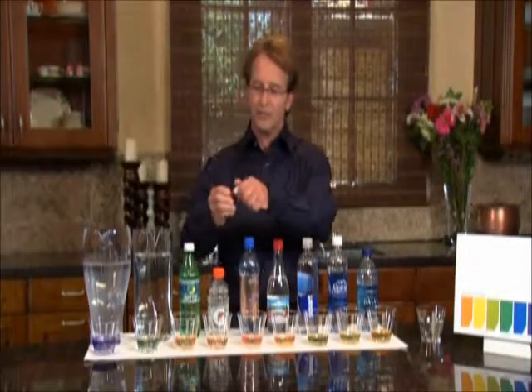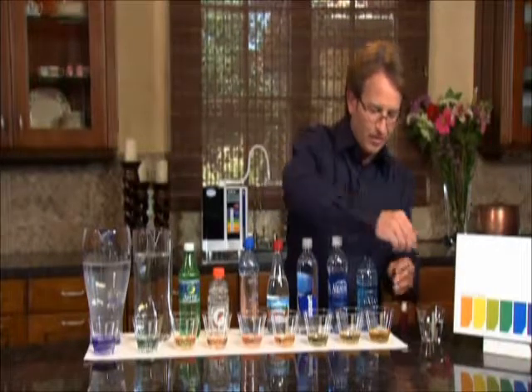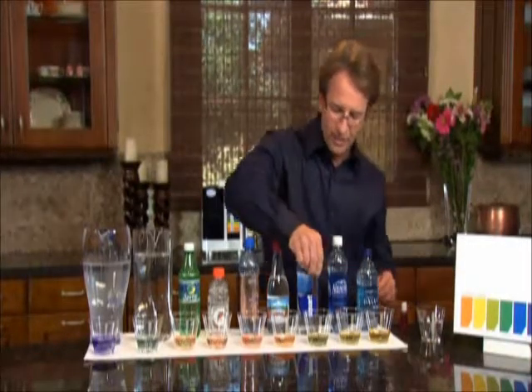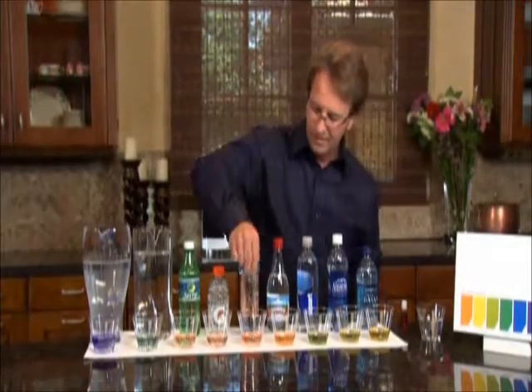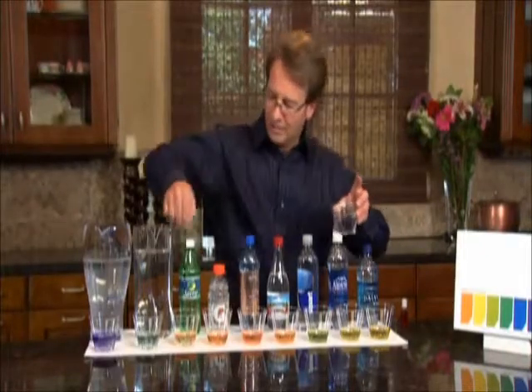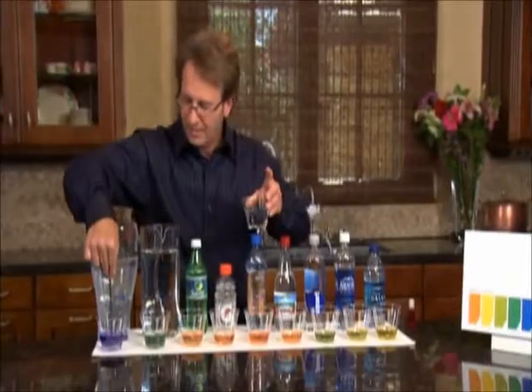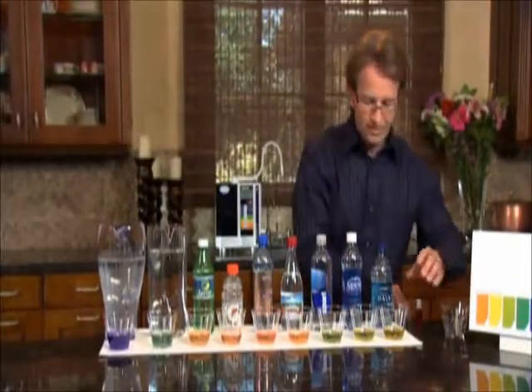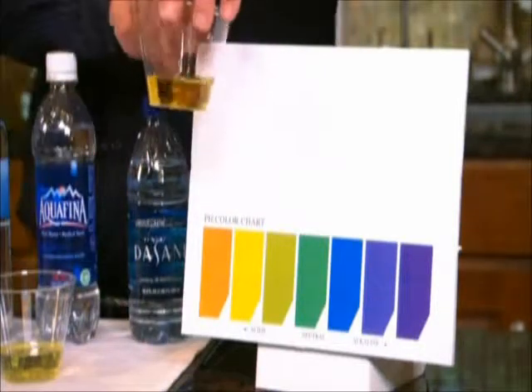We have a nice little pretty colorful display today, right? And we'll kind of stir these up real quick so you can get a better look, and then I'll show each one of them. Let's clean it off each time. Okay. So let's start here with the Dasani water, and we'll use this pH chart here and show.